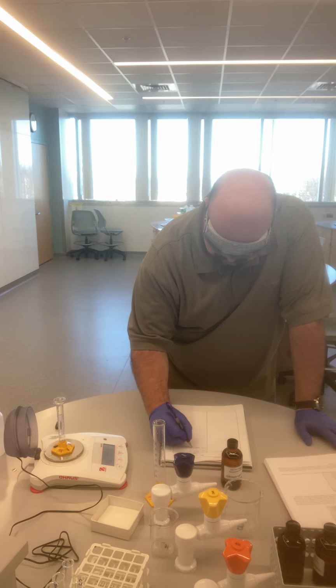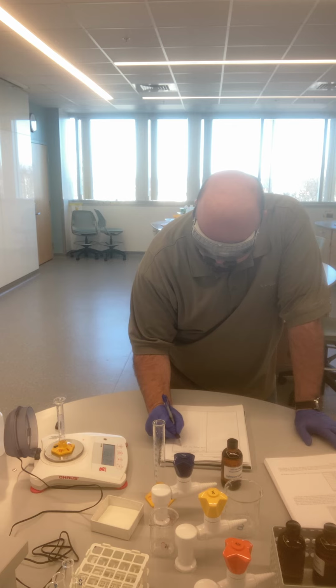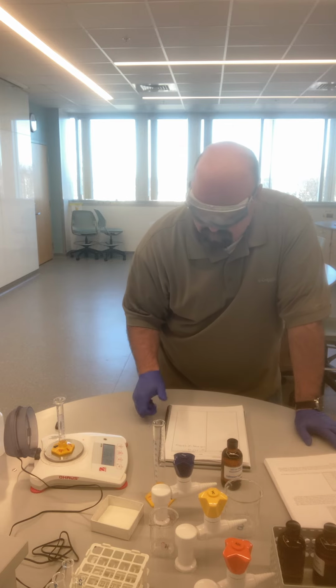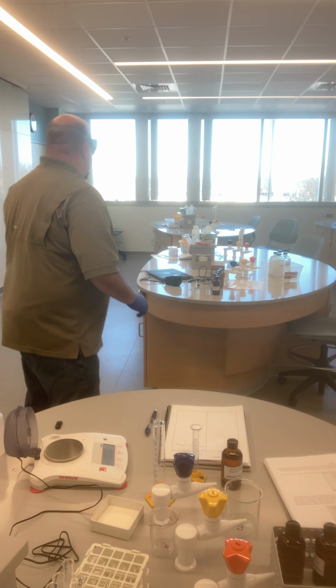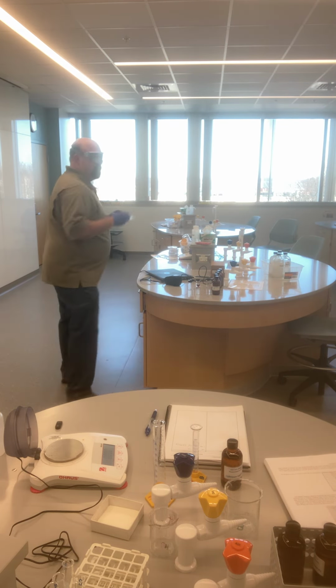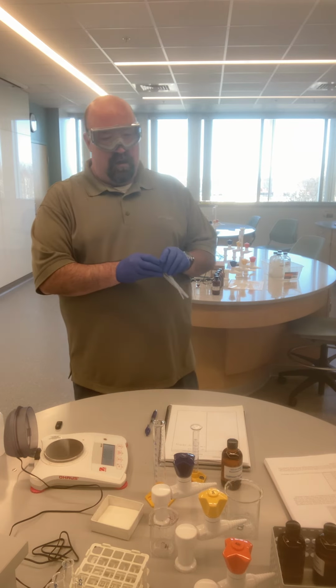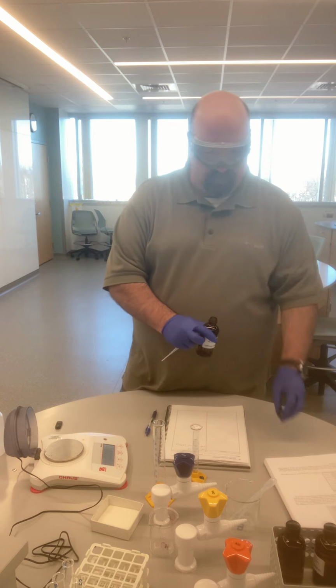I find that the mass of my empty cylinder, and this will all be in your data form, or your data spreadsheet that we provide, is 27.921 grams. I'm then going to add some of liquid 1. Getting some pipettes that I have behind me here. I'm going to add some of liquid 1 into the graduated cylinder.